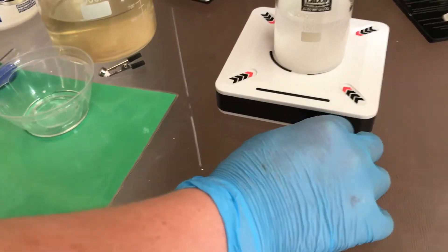This is an exothermic reaction, meaning that as the sodium hydroxide dissolves it can get quite hot.